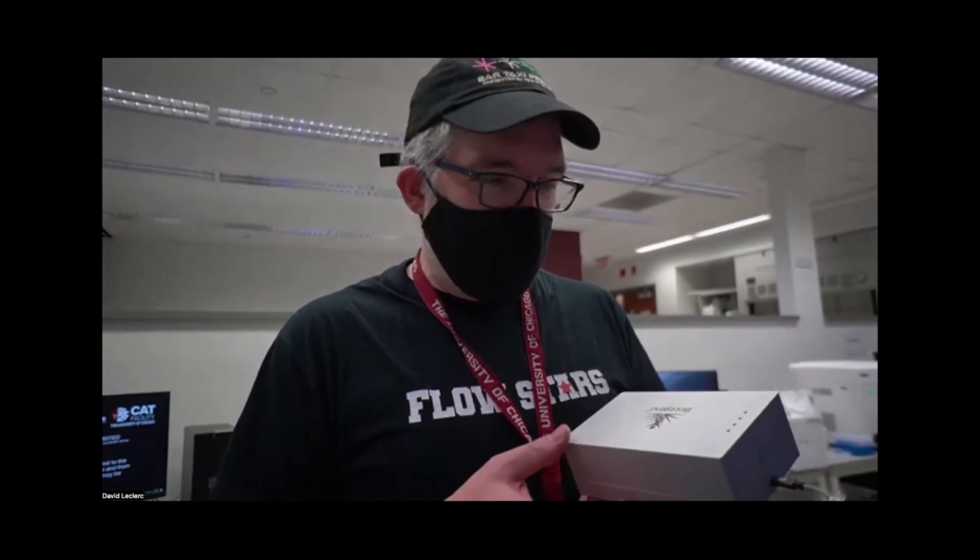Hello all, this is a quick tutorial on the BioLegend mini ELISA plate reader. It's a neat gizmo that we got a few months ago, makes ELISA reading fairly easy.